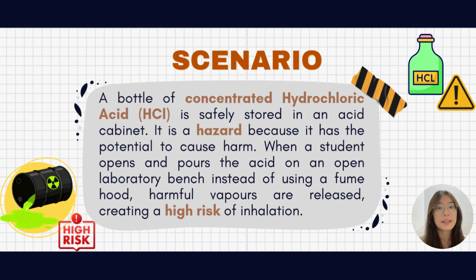Our group will present Scenario 1, the fume hood bypass. In this scenario, a bottle of concentrated HCl is safely stored in an acid cabinet. At this stage, it is considered a hazard because it has the potential to cause harm. However, when a student opens and pours the acid on an open laboratory bench, harmful HCl vapors are released into the air. This creates a high risk of inhalation for everyone in the laboratory.